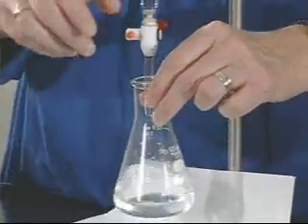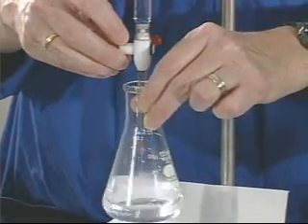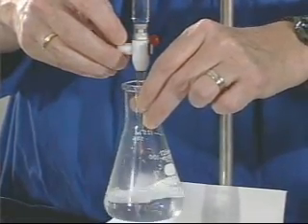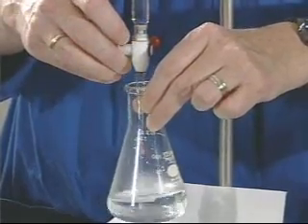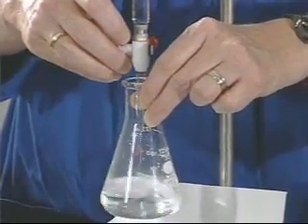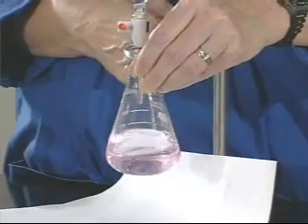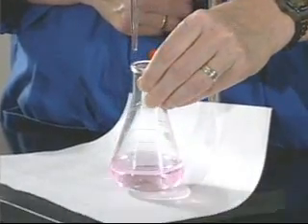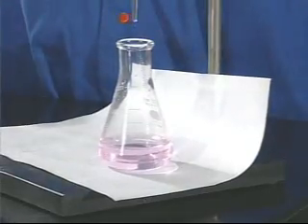You have learned something in lecture about what a titration is. The basic idea is that you have an unknown substance and a known substance. You take the known substance and you add a measured amount of it until it completely reacts with the unknown. At that point, you stop the reaction, and then you can do a calculation to determine the amount of unknown from the amount of known that you used to complete the reaction.